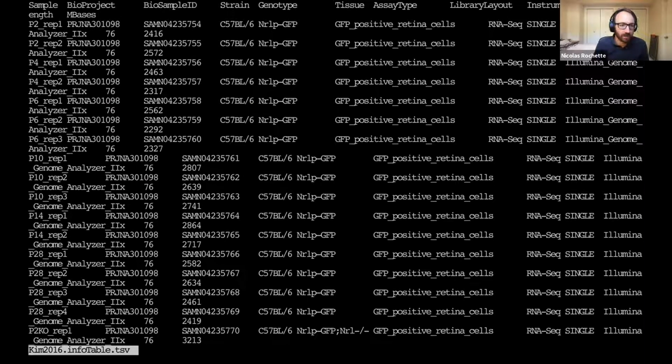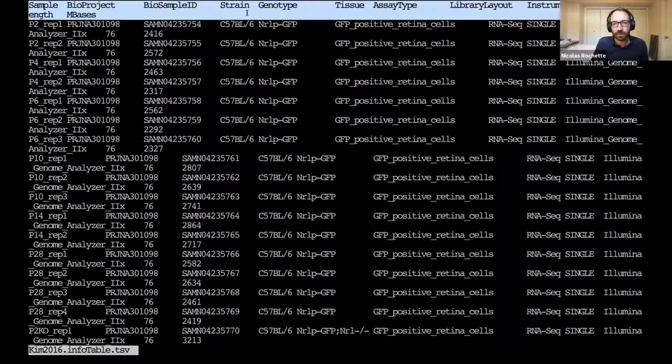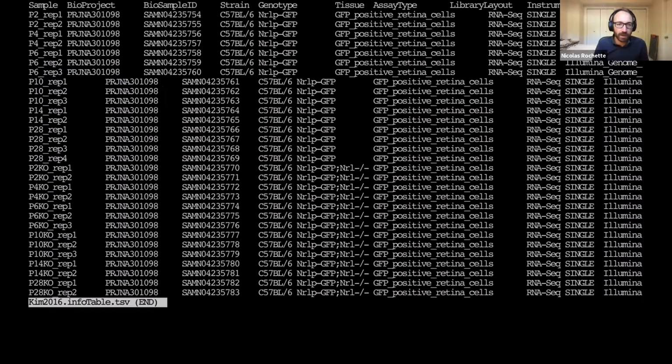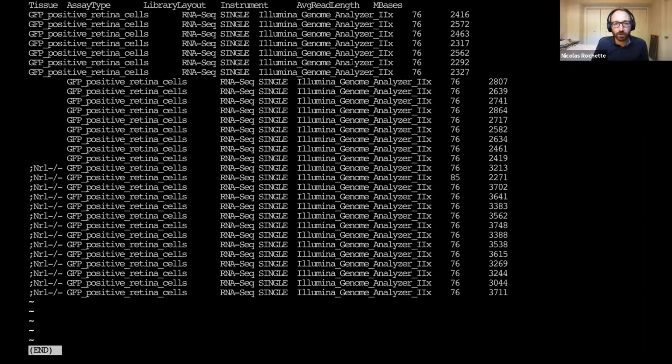and it doesn't work as well as before. The reason is that this is a header line. It's one line, just the header line for the table, but it wraps around and continues on a second line. And when this happens, what we can do is use less with the capital S option. And now we have the header line that just keeps going on the right, and we can move with the arrow keys to the rest of the table.